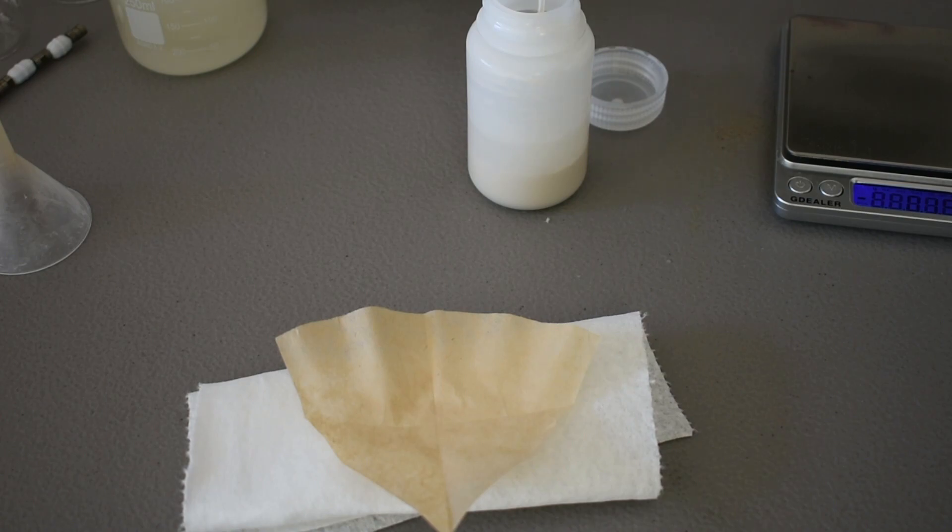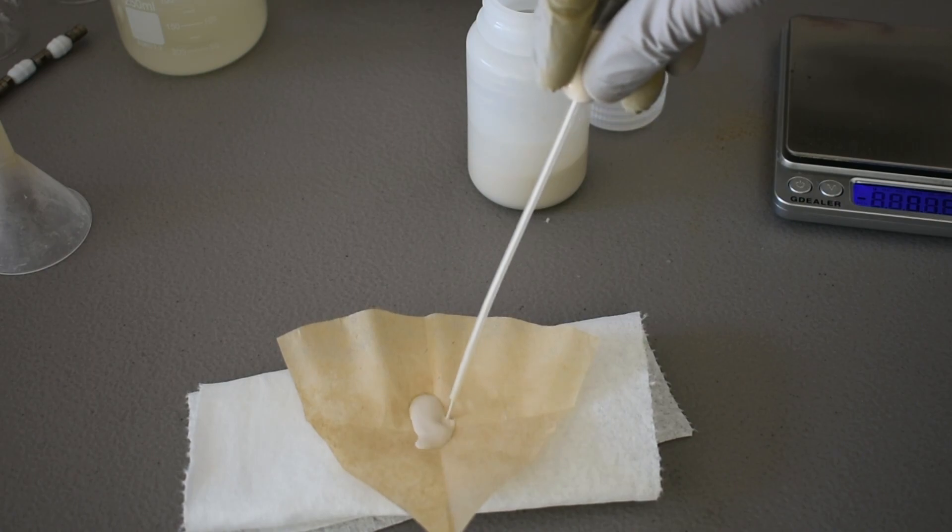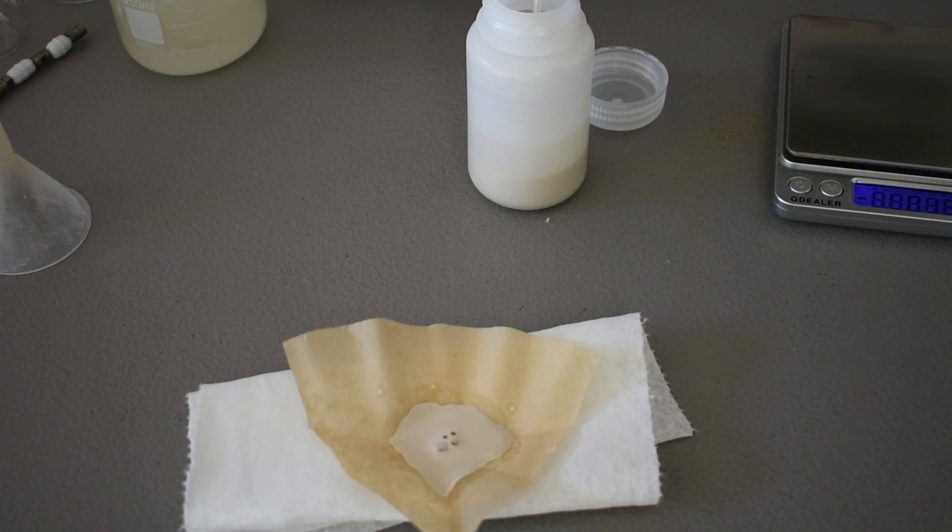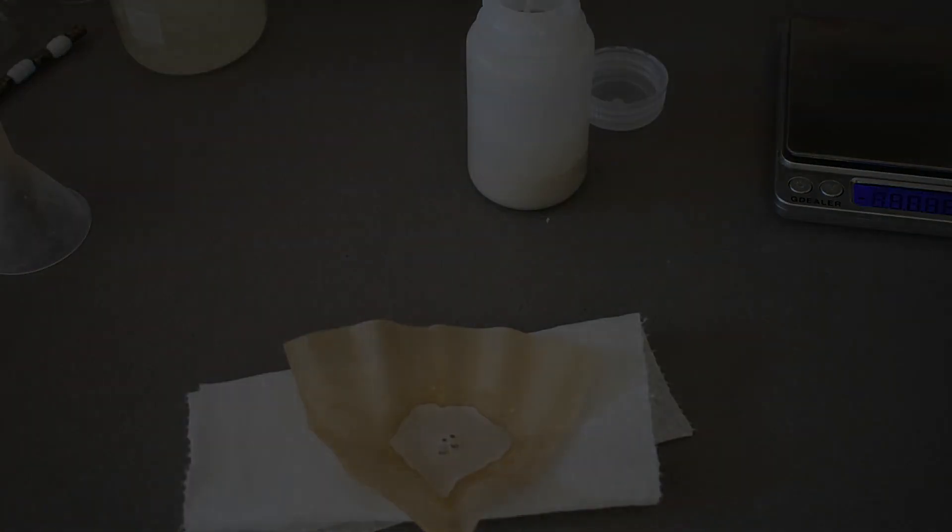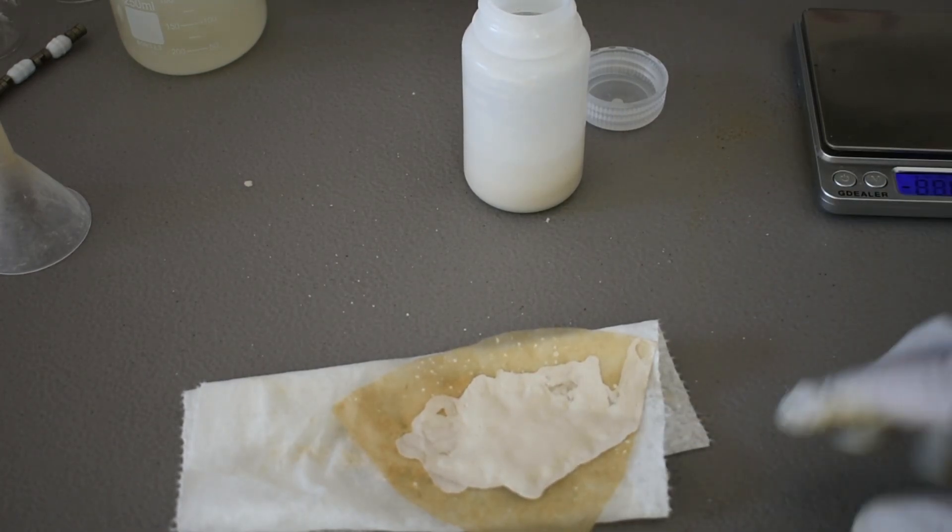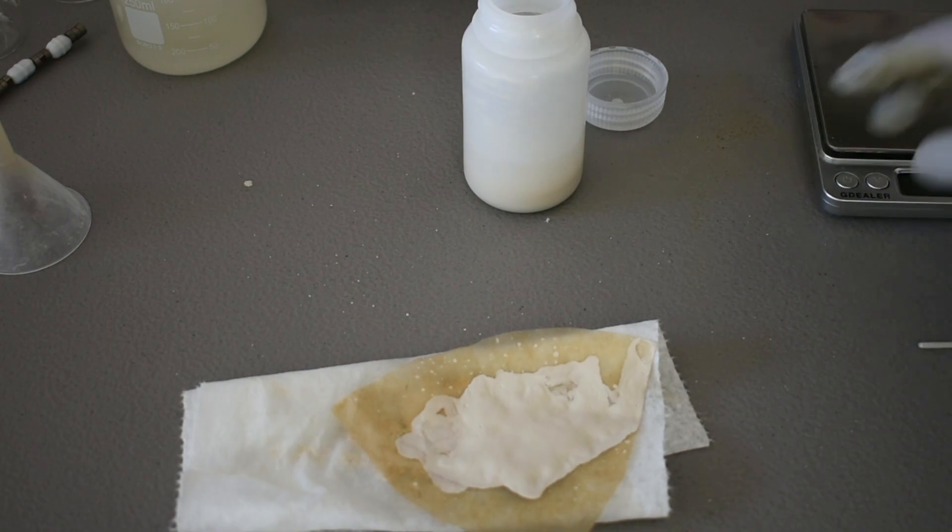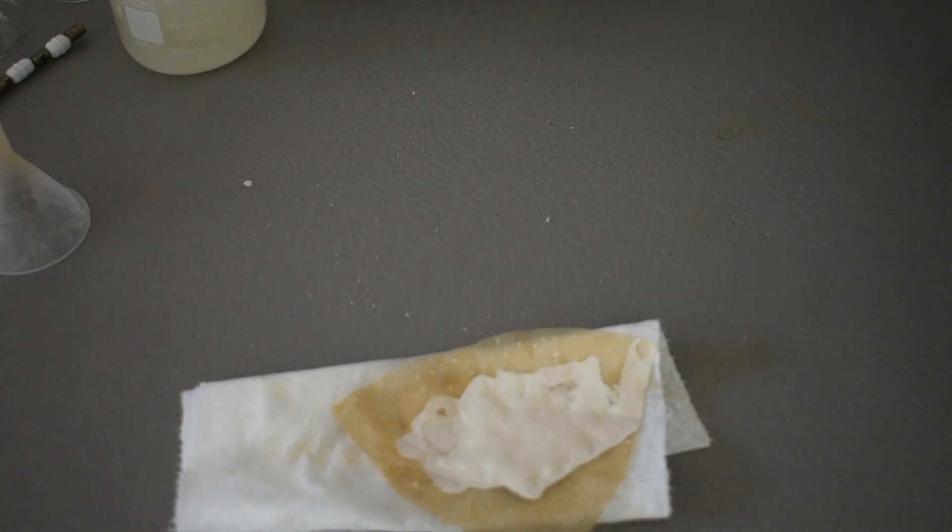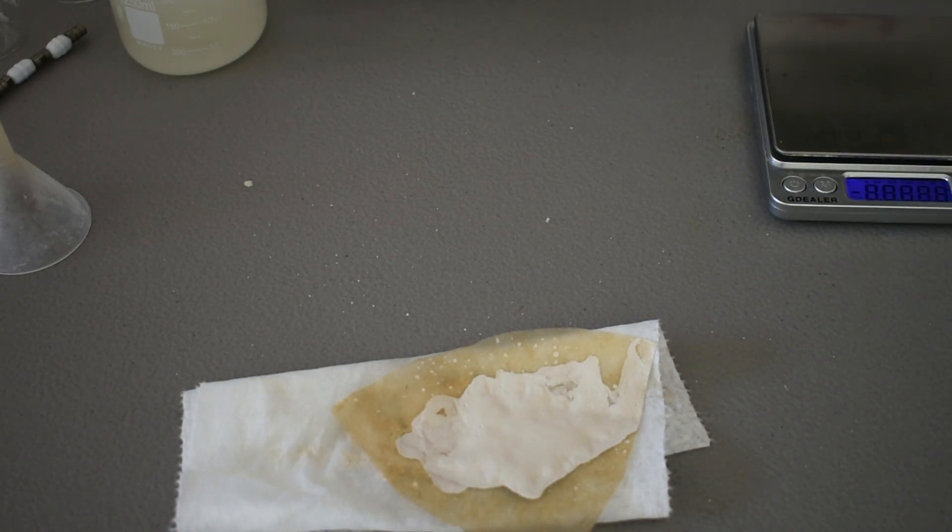And then I'll start pipetting out our copper iodide. It kind of looks like chocolate milk. It's a nice suspension. This is about five grams counting water. Doesn't matter, dampness. So now what we're going to need is some more of the potassium iodide. And we're going to need seven and a half grams of the potassium iodide. So I'm going to make another weighing boat. And I'll be back when I have my weighed potassium iodide.